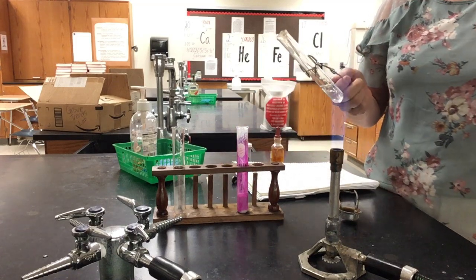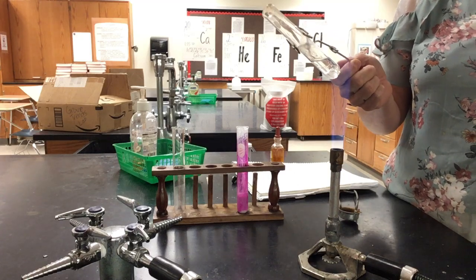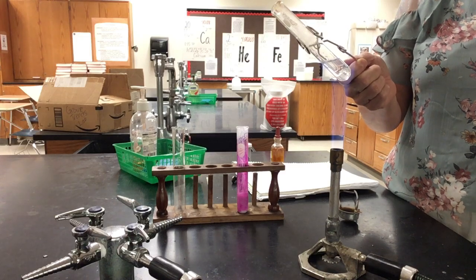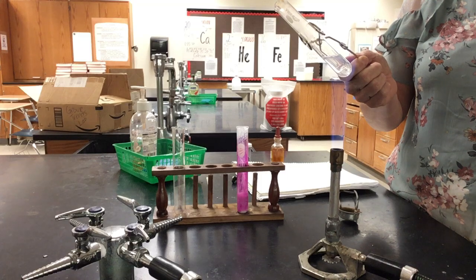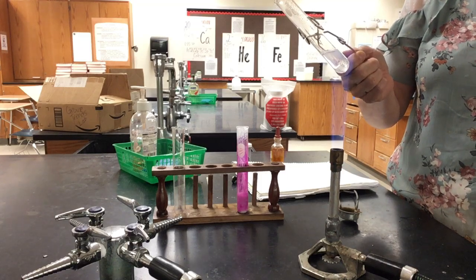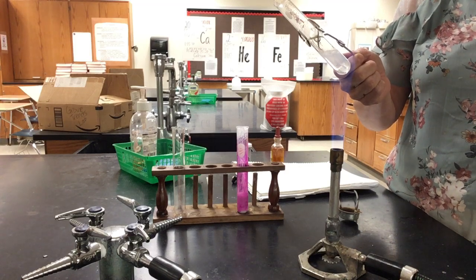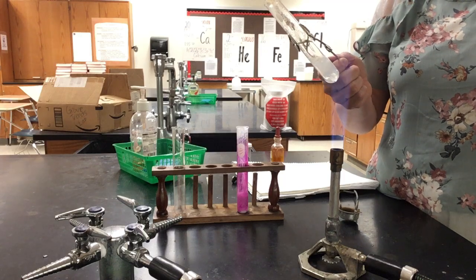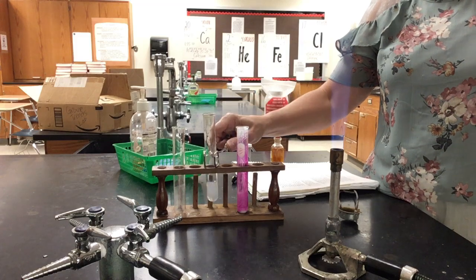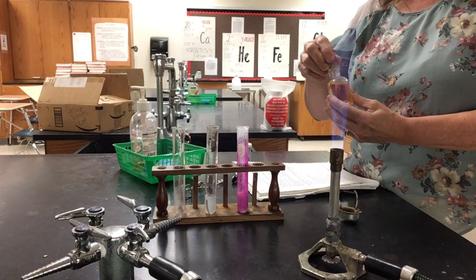So what I'm going to do is heat this, so that the water gets hot, which allows it to react with the magnesium better. The magnesium has a little bit of a coating on the outside, so the extra heat allows it to react. And again, it is creating gas, but not enough that we're going to hear that popping noise. But hopefully, because it's in the same column, we should see the same reaction with the phenolphthalein.